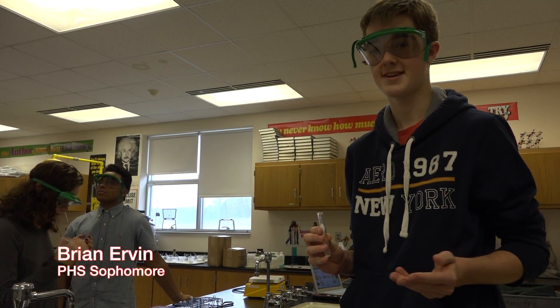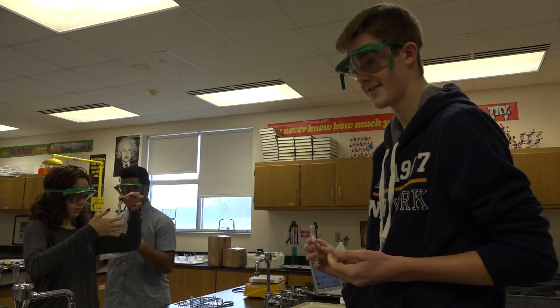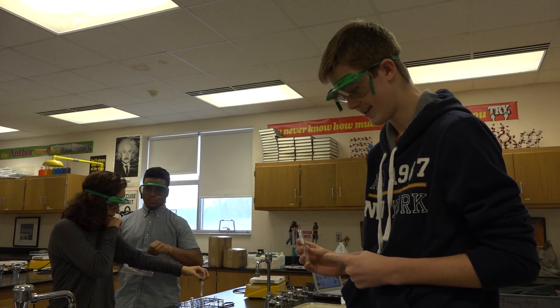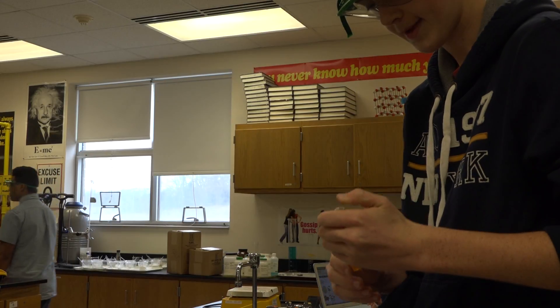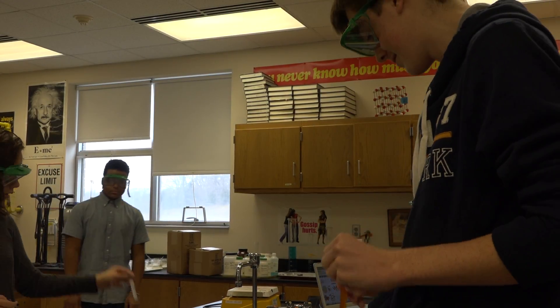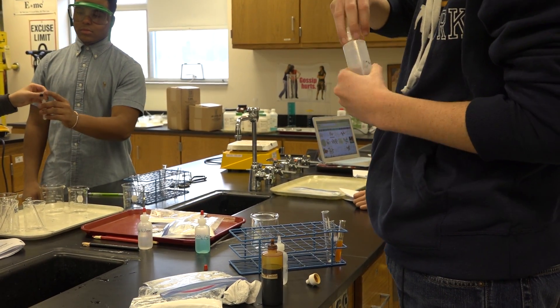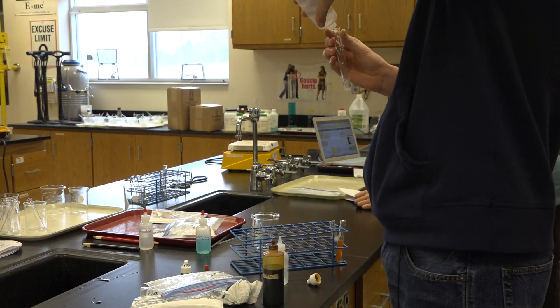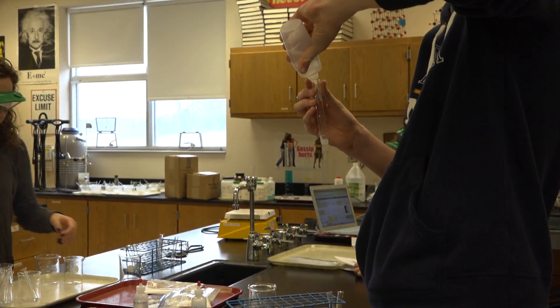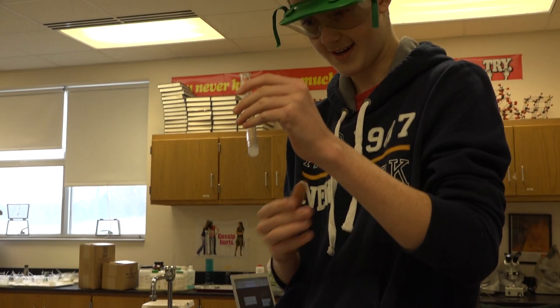We're testing to see if this substance is one of eight substances. To do that we have to perform certain tests. This substance is insoluble in water, so we're going to perform an iodine test. Since it didn't turn blue, it's not cornstarch. So we performed a vinegar test on a new test tube — if it starts forming bubbles it's calcium carbonate. It's bubbling, so it's calcium carbonate.